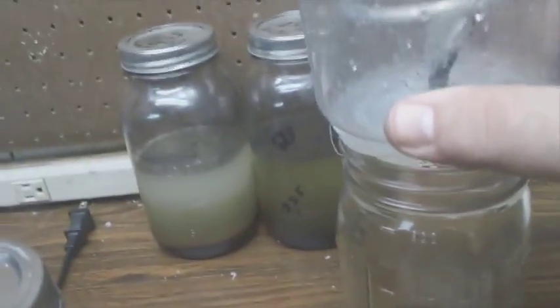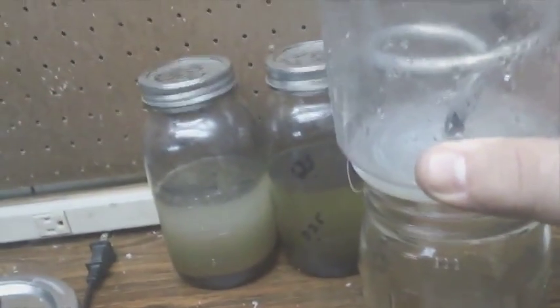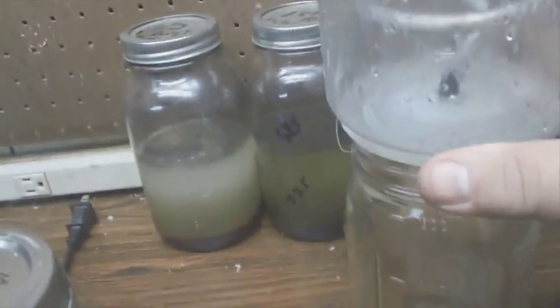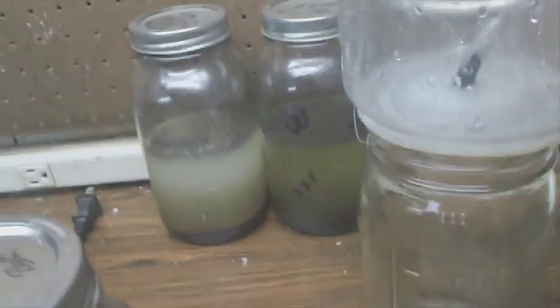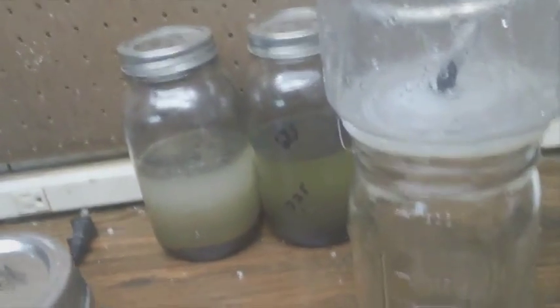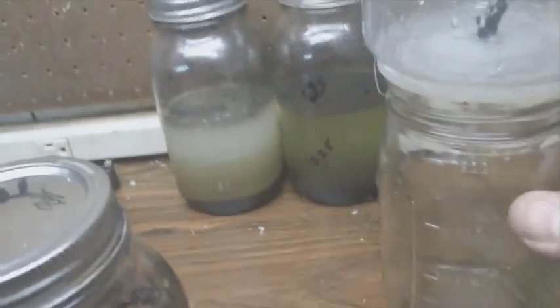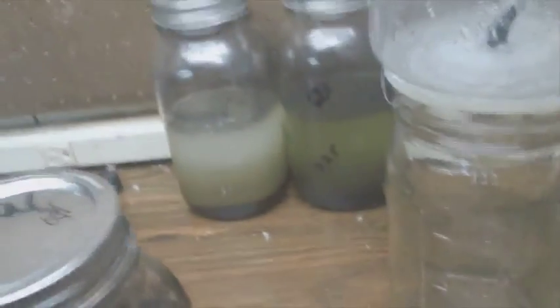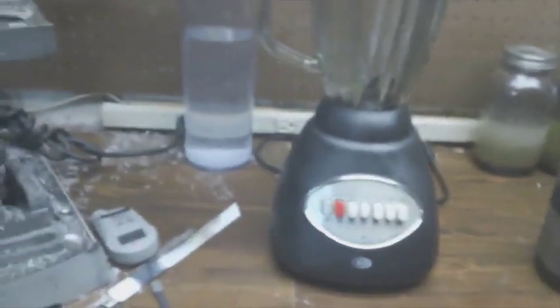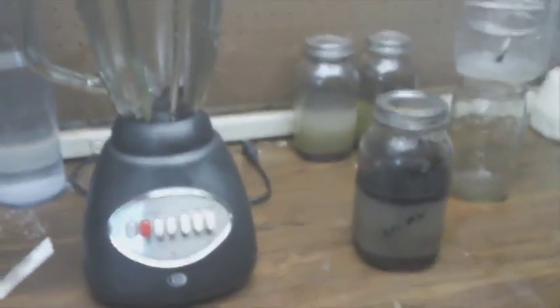This right here, when you lift this to vent slightly, it just started dripping - you're letting some of the gas escape there, but such a small amount that I'm pretty sure I can reuse acetone multiple times to reduce the cost.